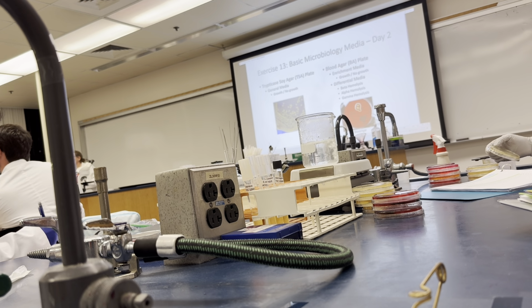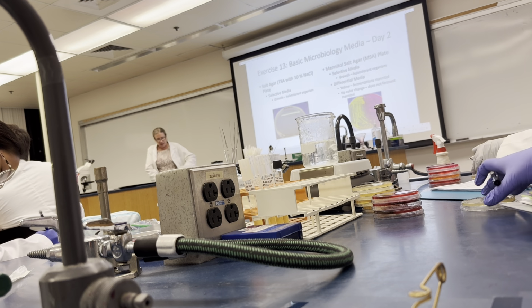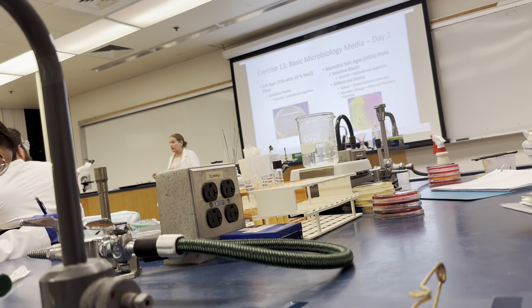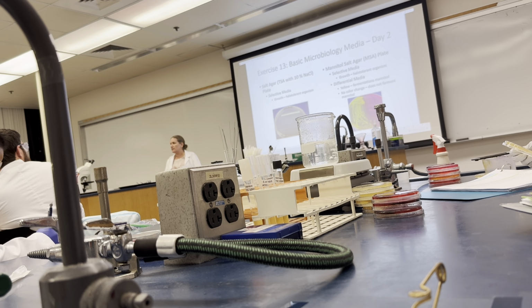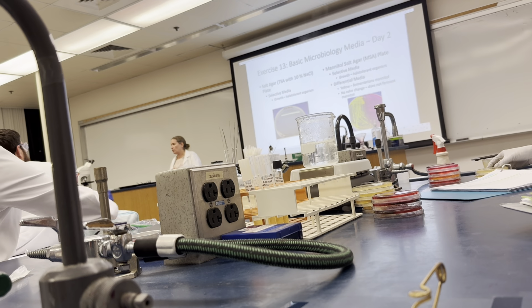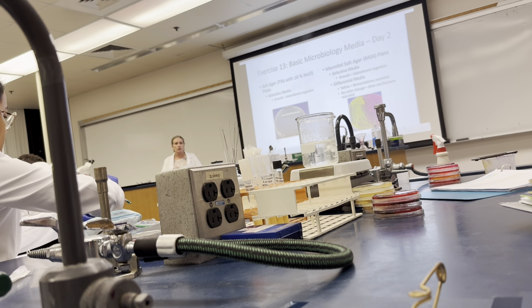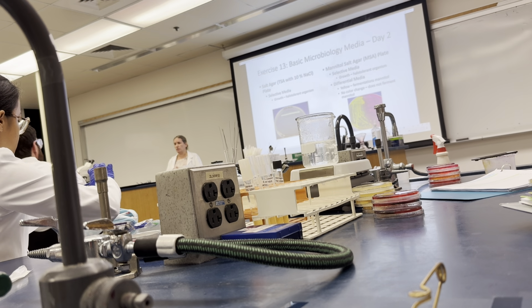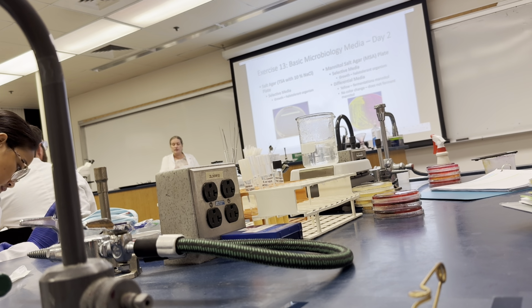All right, the next one we're going to look at is the salt agar. The salt agar is TSA with 10% sodium chloride. Remember what I told you last lab? 10% sodium chloride is what you'd have to give on a test if you were asked. Sodium chloride can be spelled out completely, or you can use the molecular formula, as long as the molecular formula is correct. But you can't tell me salt. If you say 10% salt, you're not going to get that credit, because there's more than one type of salt. So you need to be specific.